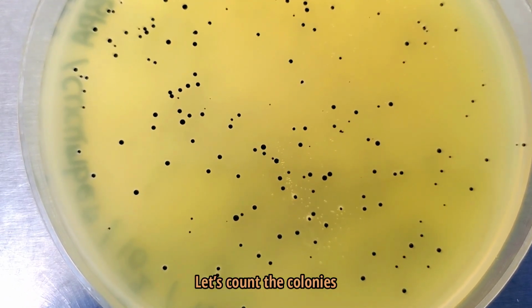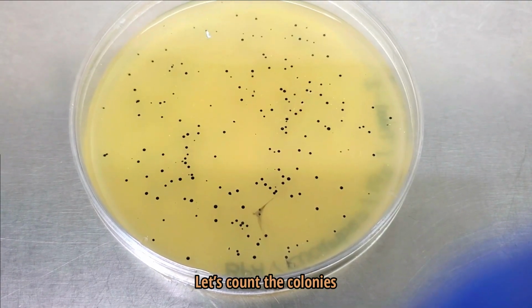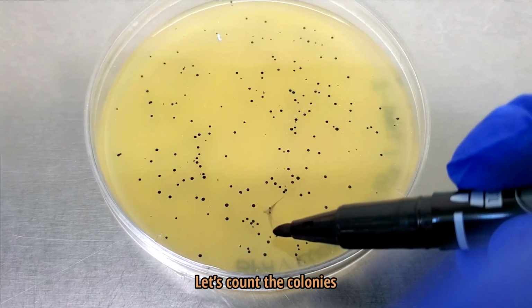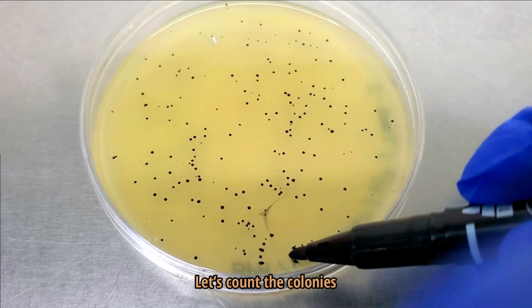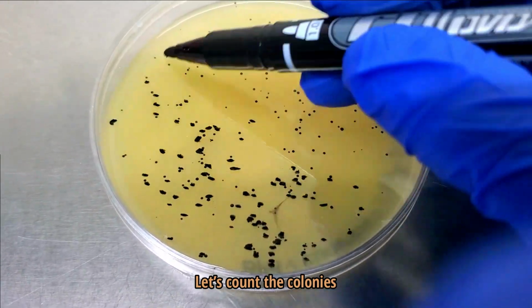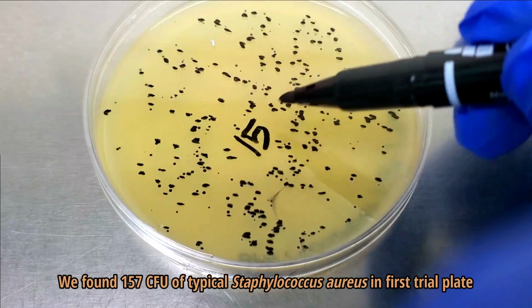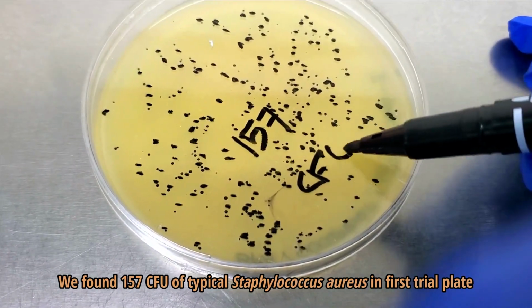Let's count the colonies. We found 157 colony-forming unit of typical Staphylococcus aureus in first trial plate.